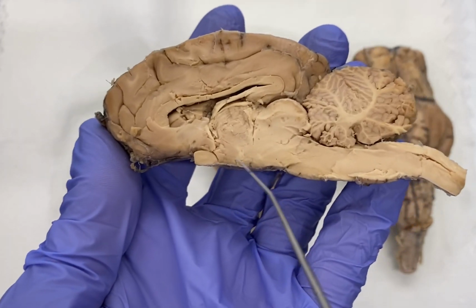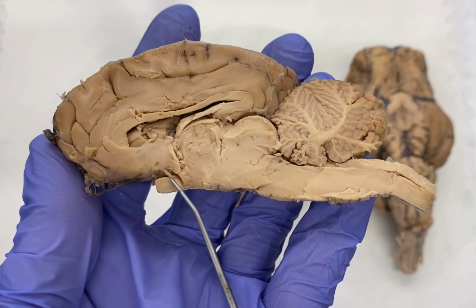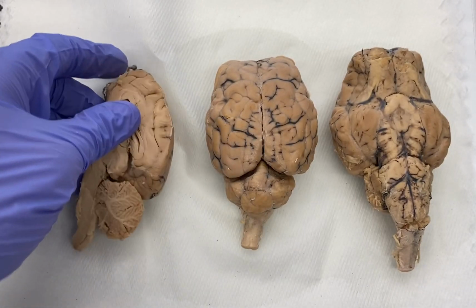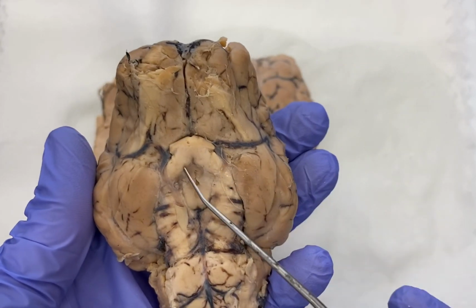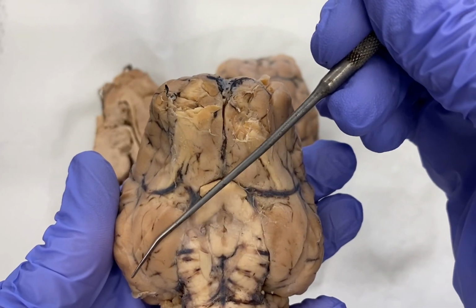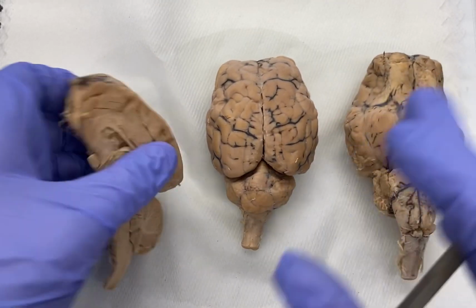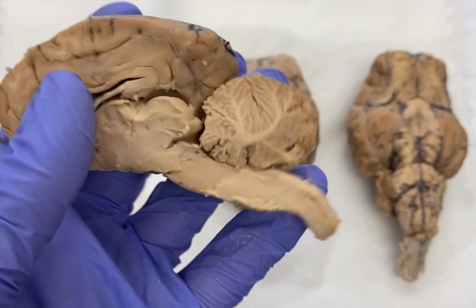You'll notice this little circular structure right here. This is a section through our optic nerve, or what's called our optic chiasm. If we look here on this brain, you see this X-shaped structure. It would be running like this, and there'd be another one running like this. This is approximately where this section is made. So cut through right here is where we have this structure, which is associated with our optic nerve.